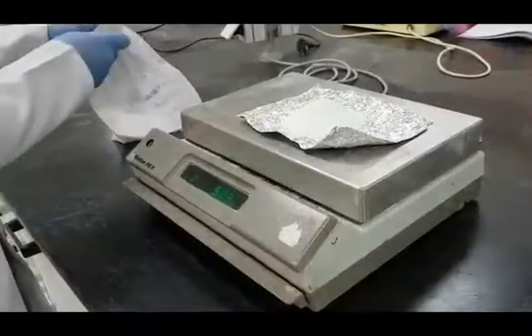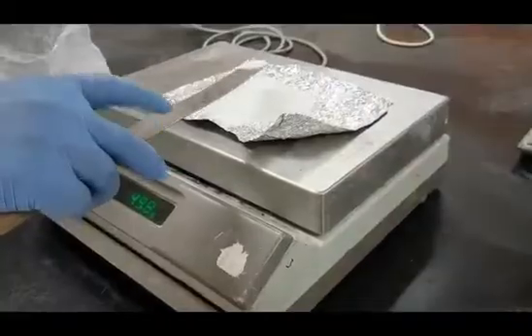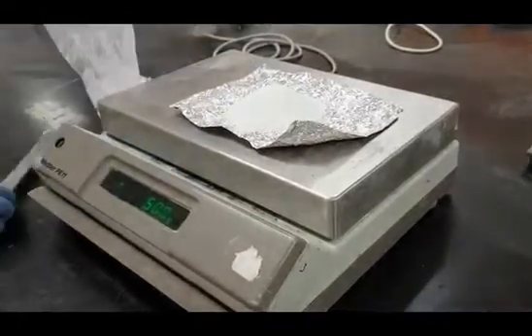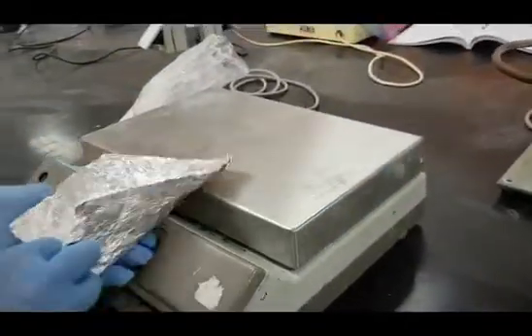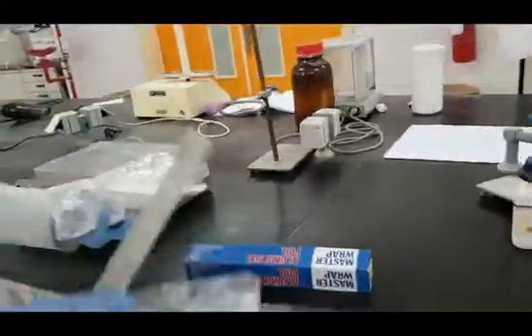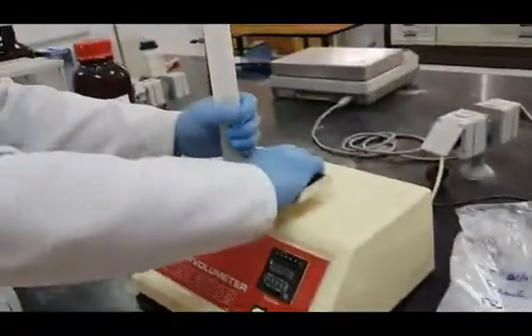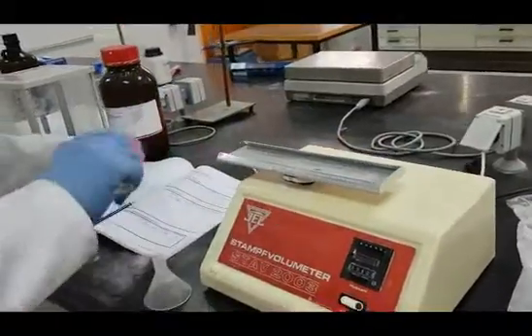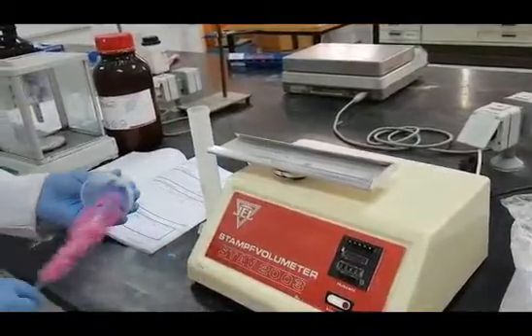Now, measure 50 grams from this mixture to measure the bulk and tapped volumes. Consequently, calculate the bulk and tapped densities, and finally calculate Hausner's ratio and compressibility index, Carr's index. Use the same procedure you did in the previous experiment.